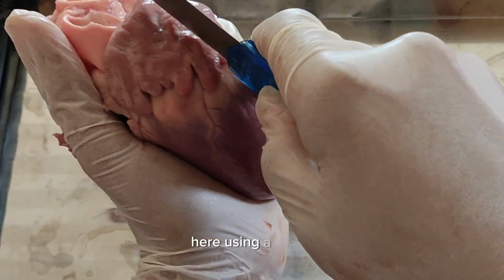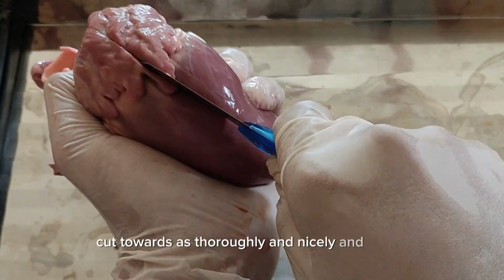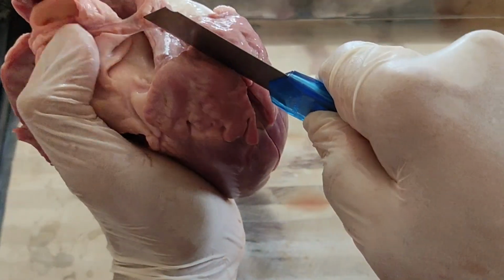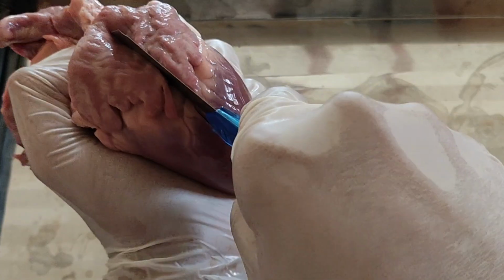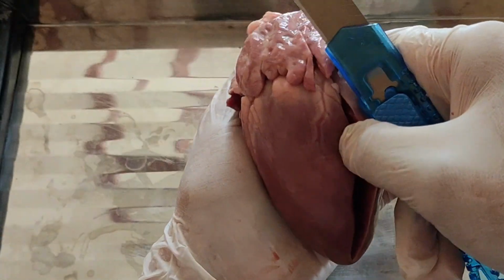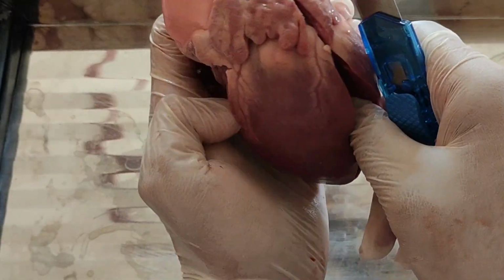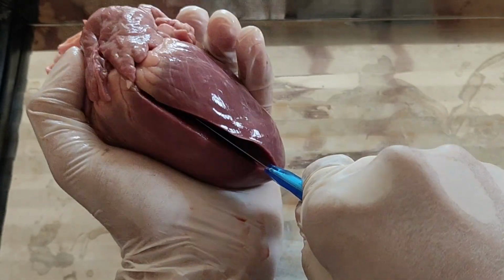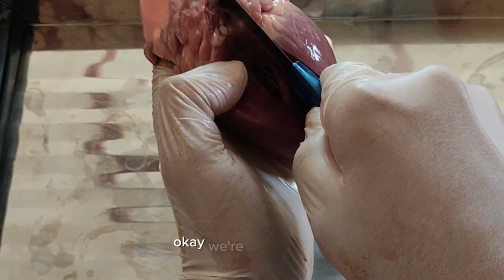Here I'm using a cutter. Cut parallelly and nicely and gently. Okay, we're not there yet.